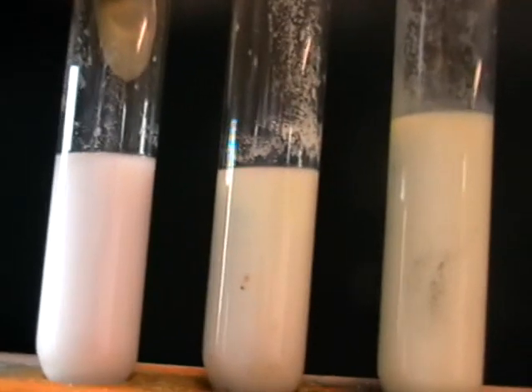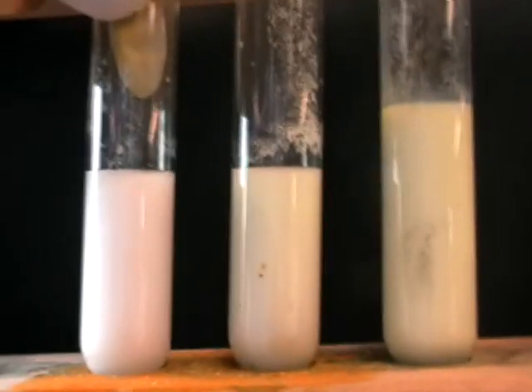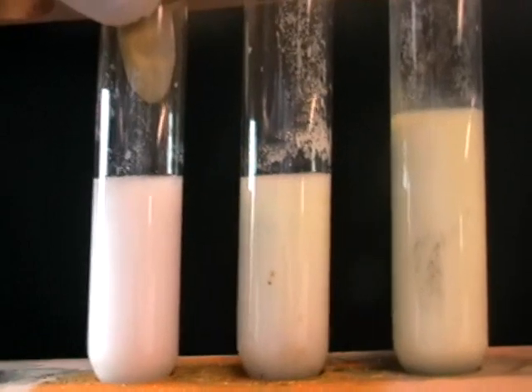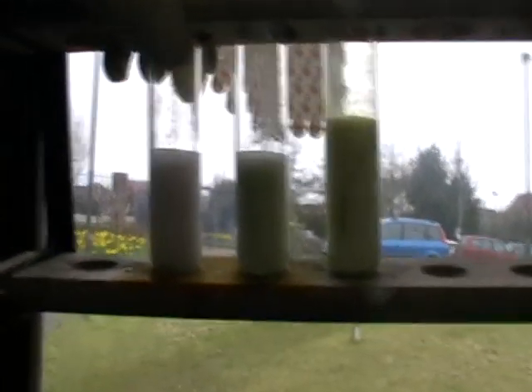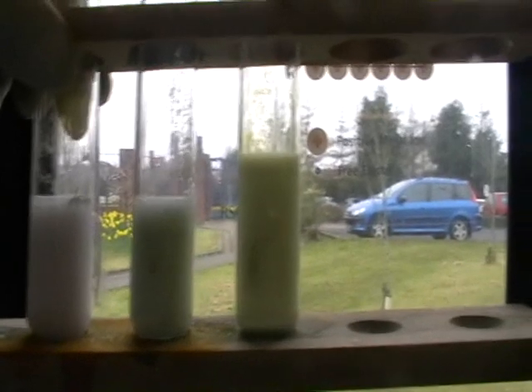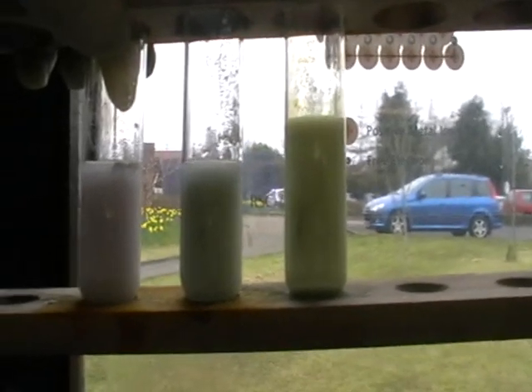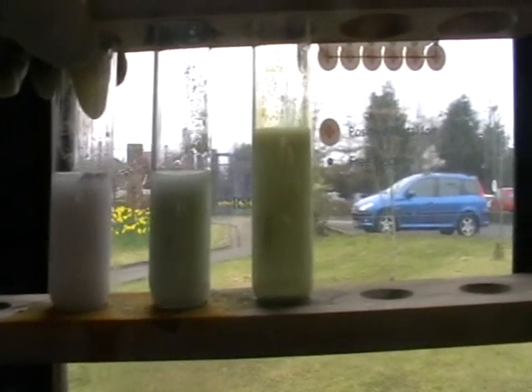I hope you can see the one on the right is yellow, the one in the middle is more of a cream colour, and the one on the left, white. These are light sensitive reactions. So let's just watch them for a few moments and see what happens. You should see the suspensions beginning to darken as a result of interactions with light.